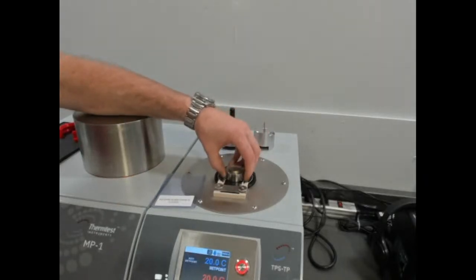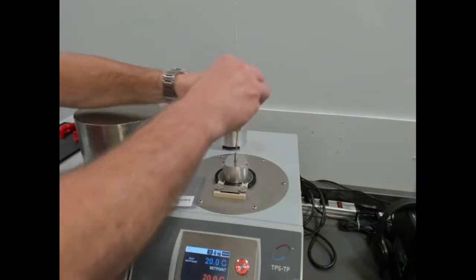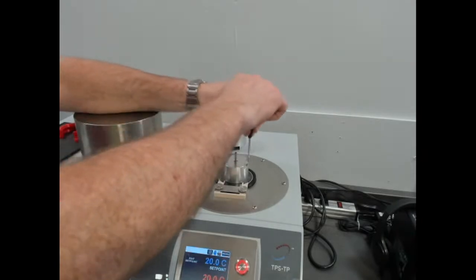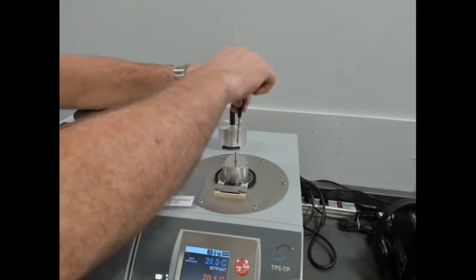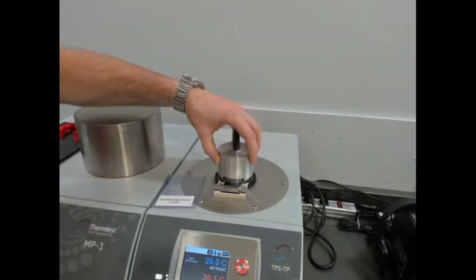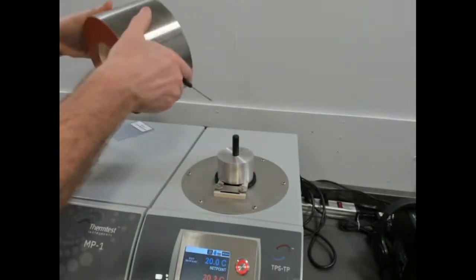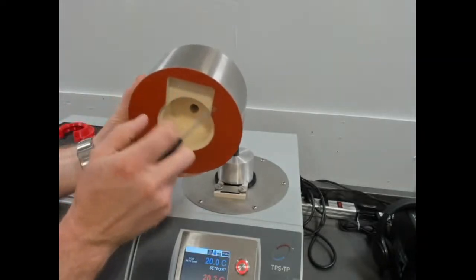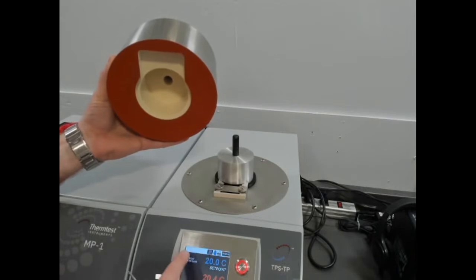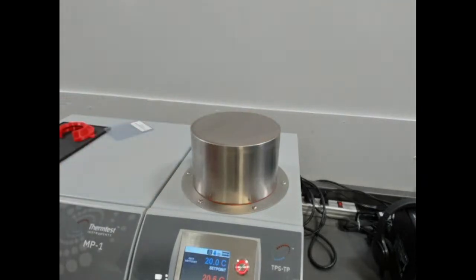So once you have your 2 pieces of sample for symmetric configuration, you place your top on, you secure it, and this middle screw just secures the 2 samples together. This completes the cold environment around it, and this is our protection, which has a magnet switch inside of it, so that when it's off, the temperature platform actually knows. So we put this back on, and that's a complete configuration.